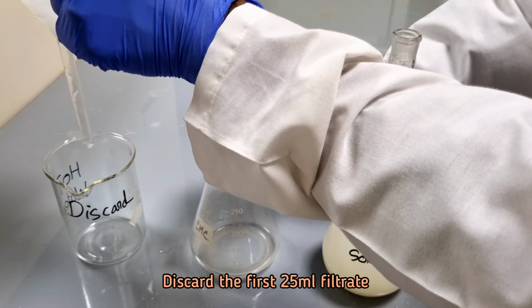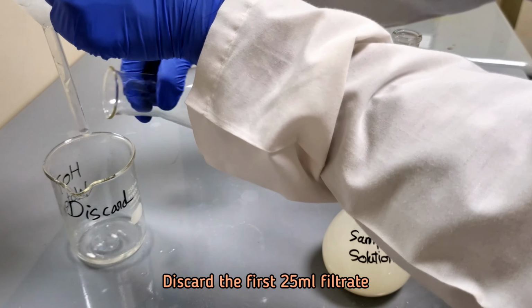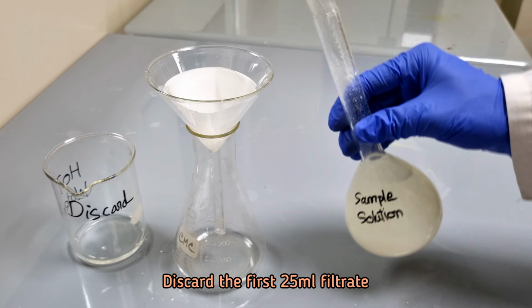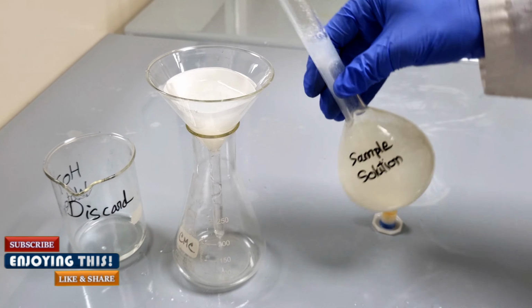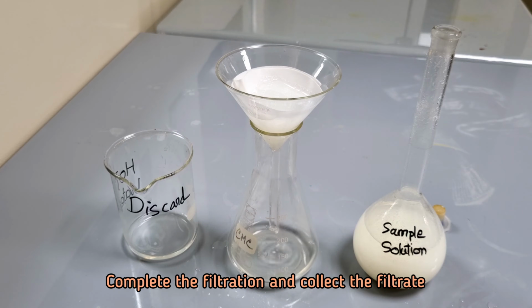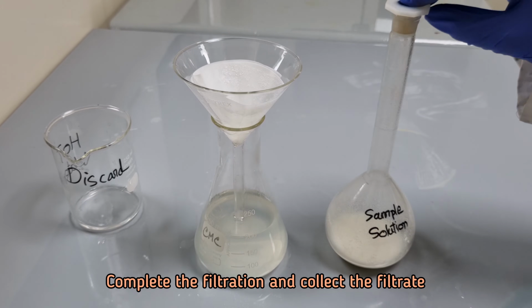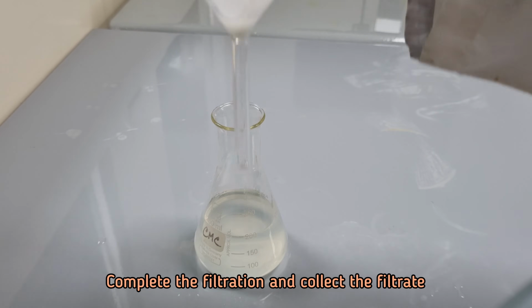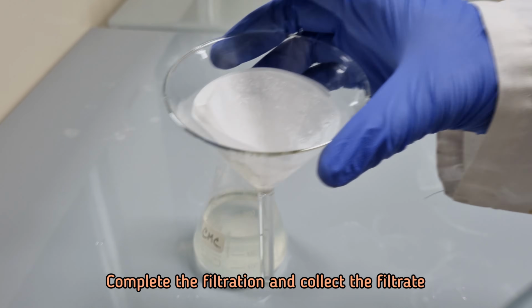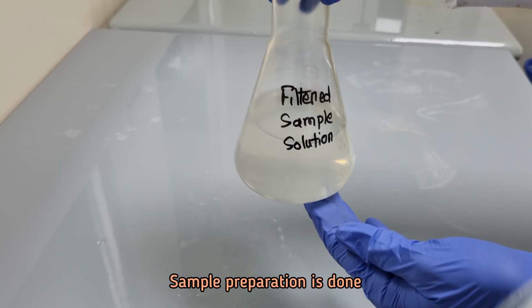Discard the first 25 ml filtrate. Complete the filtration and collect the filtrate. Sample preparation is done.